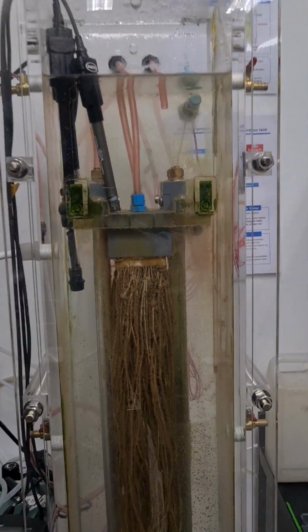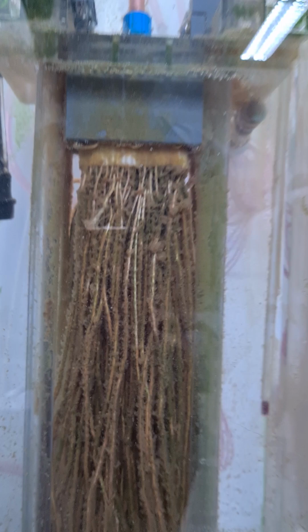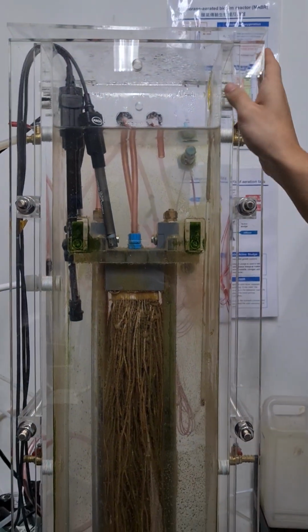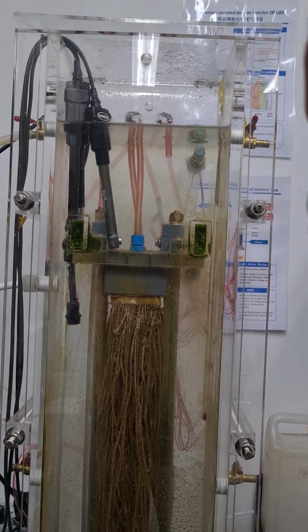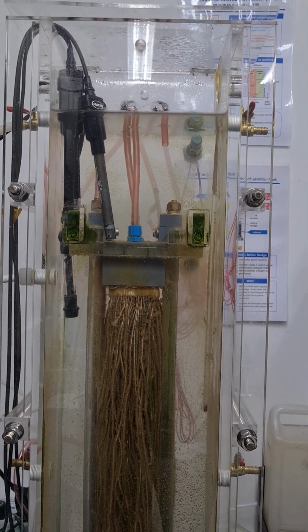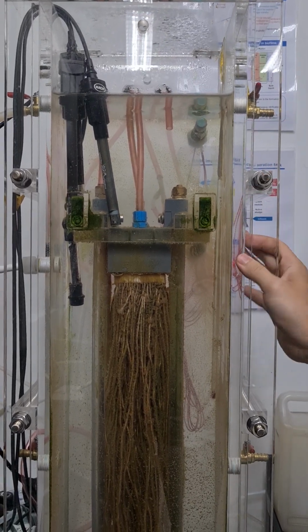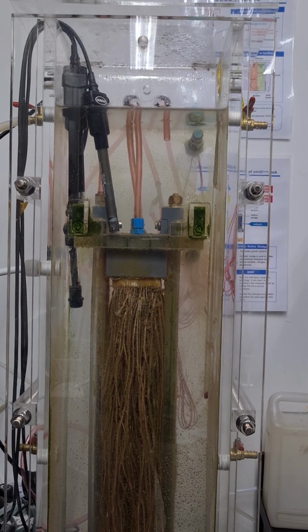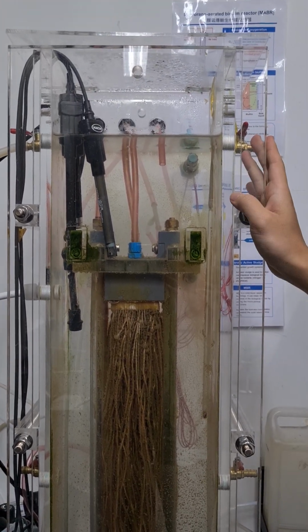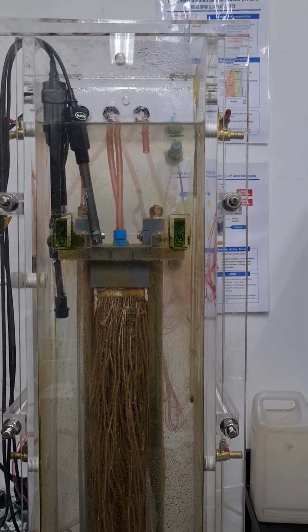How about when you keep growing this biofilm? What's the best way to control the biofilm thickness? Actually, for the thickness, since Anammox grows very slowly, the usual control strategy is bubble scouring, but we are worried that if we use bubble scouring, the detached biomass will not recover in a short time. So actually, we didn't use bubble scouring. But if you really want to control the biofilm thickness, usually we will use bubble scouring.